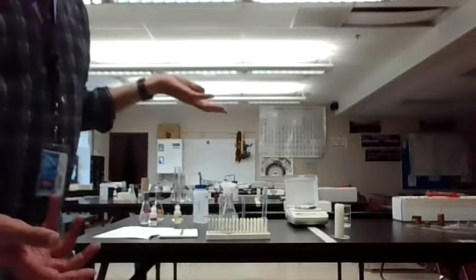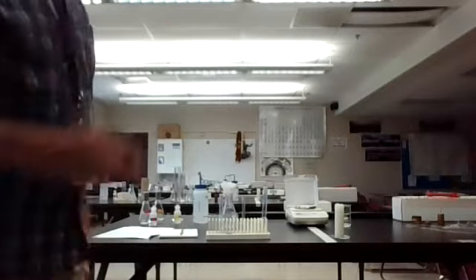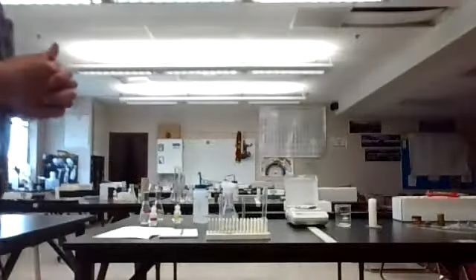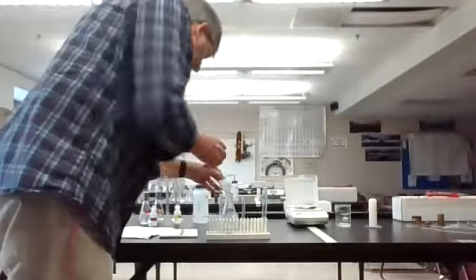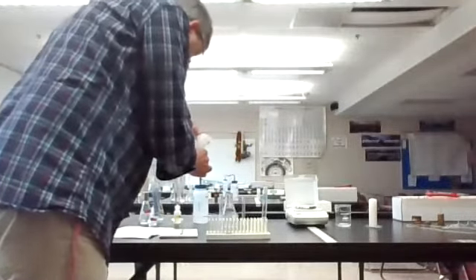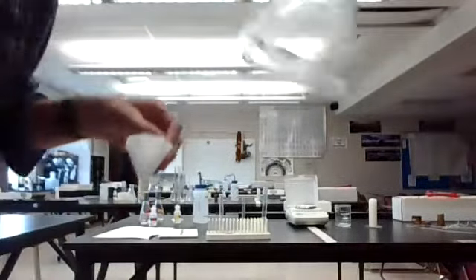Like I said, technically you could, but it would take a lot of effort, so it's just not something that happens. Generally speaking, that's a good example of a chemical versus a physical change. So to finish this off, I think this is pretty much true. Okay, we've got the little bit of liquid down here.